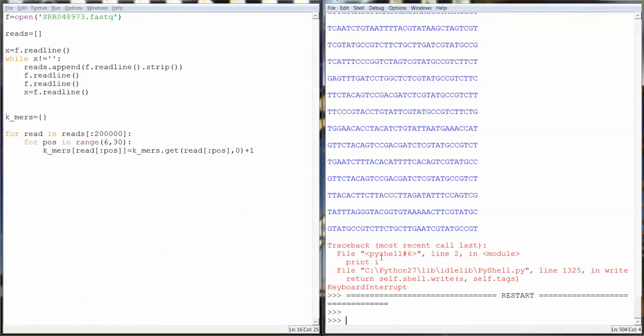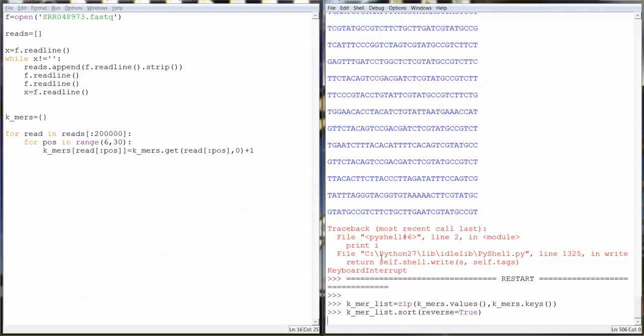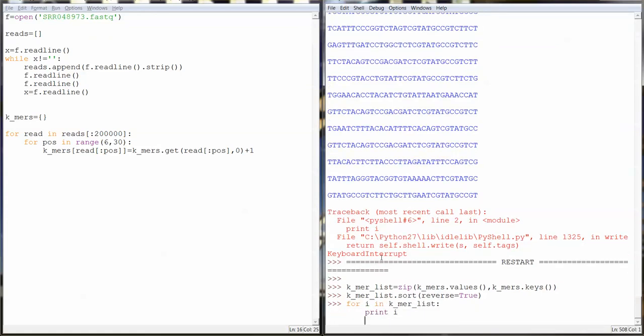The interesting thing about dictionaries is you cannot sort the dictionary, so we're going to have to convert the dictionary to a list. And what we can do is use the zip method to zip the values of the dictionary and the keys of the dictionary. So basically the entire dictionary, the values and the keys, but now it's a list. So now that we have a list, we can use Python's sort method, and we can set reverse equal to true, and that will get sorted. And now we can identify the most abundant k-mers in this data set, or at least in the first 200,000 reads. So for i in k-mer list, print i.